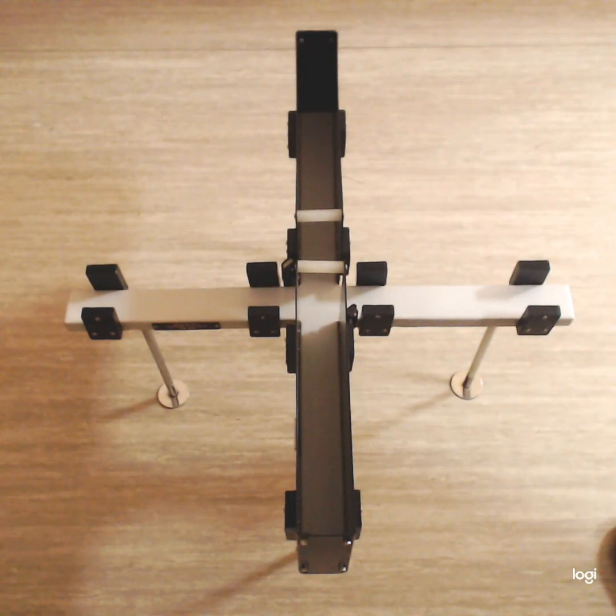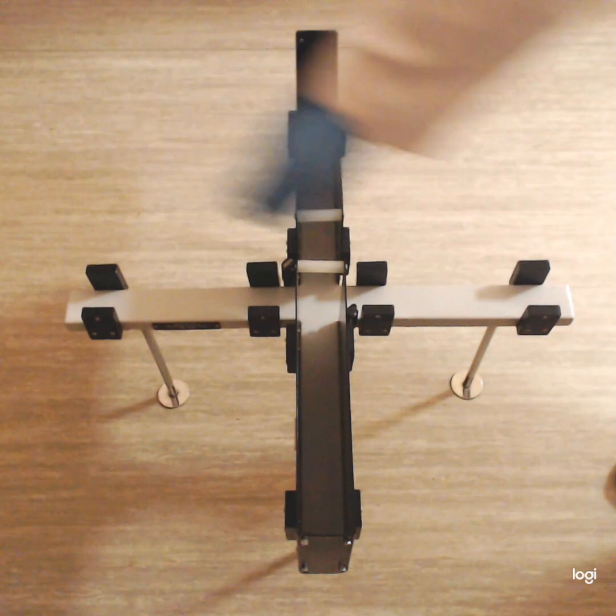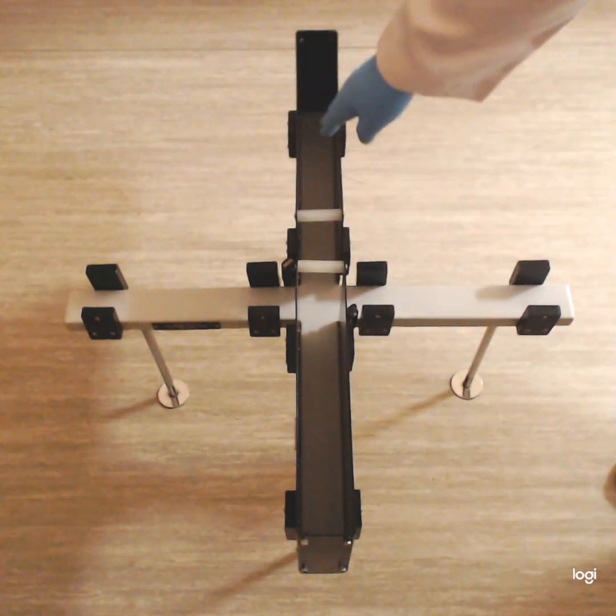To describe this apparatus, it is elevated at 30 centimeters from the ground. It has 4 arms, as you can see. 2 arms are closed arms. They have side walls on 3 sides, and 2 arms are called open arms. You can see these 2 arms are open arms, these 2 arms are closed arms.